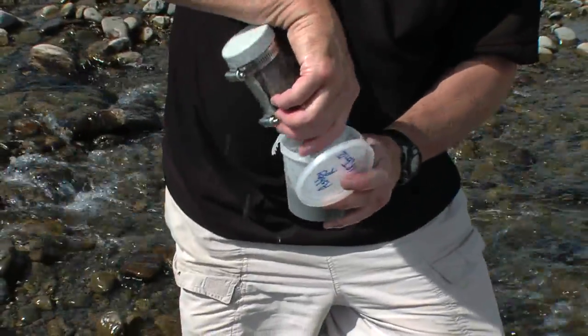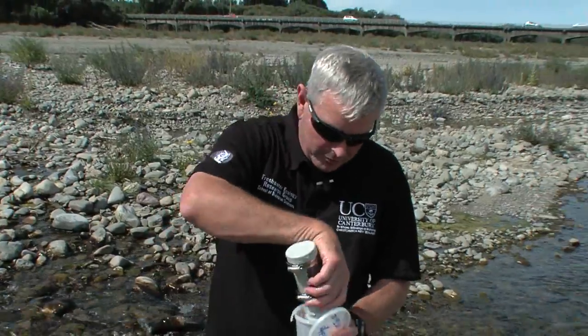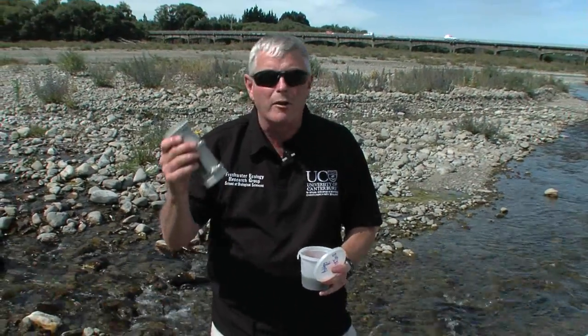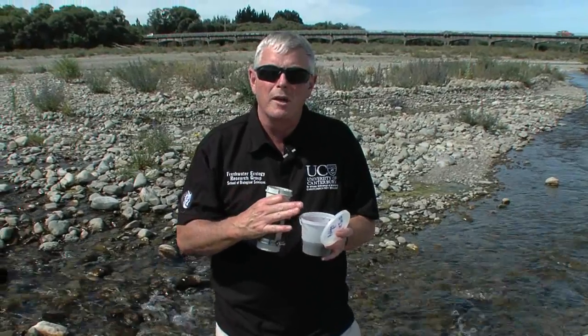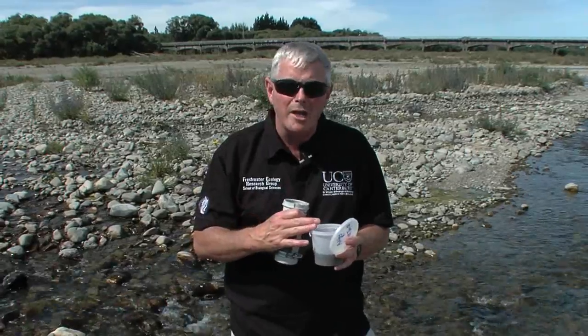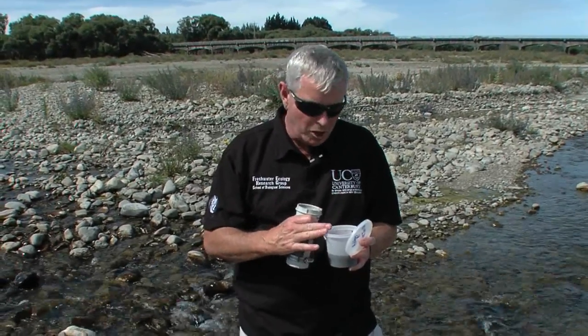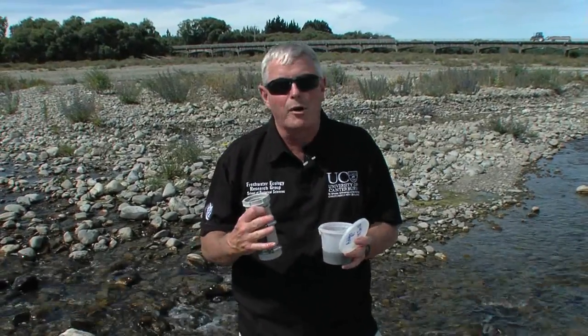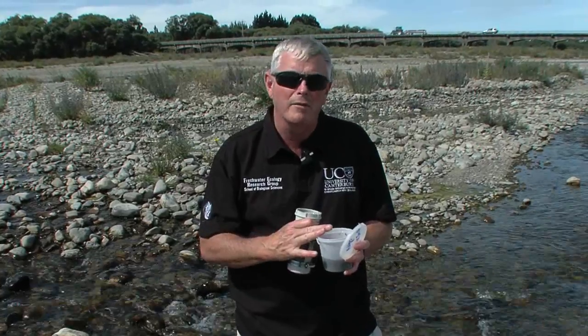We need to add a little bit of water to it here, then make sure that our pottle is completely empty and we haven't got any sample left in it. If I'm going to process the sample in a couple of days or later on, then I would add ethanol. Usually, if you were going to take this back to the laboratory and process it within an hour or two, you may not preserve the sample — you may not add ethanol.